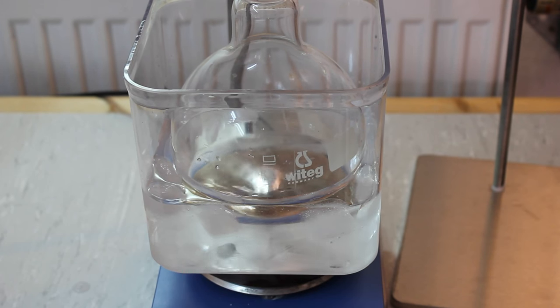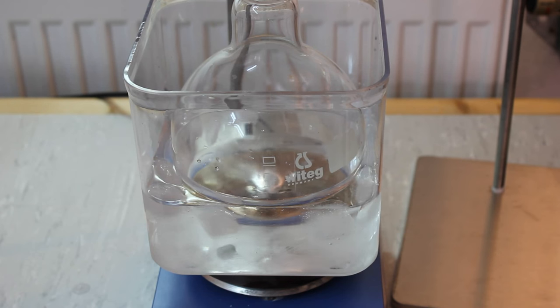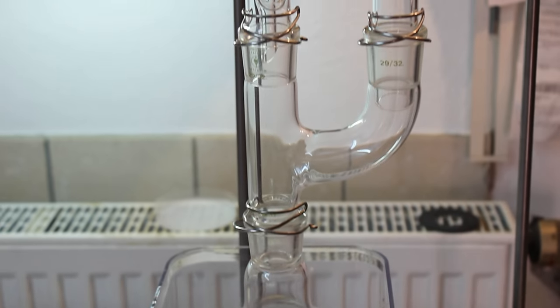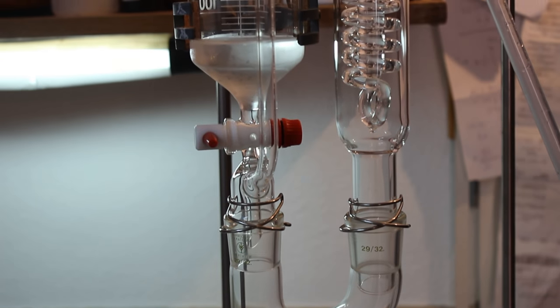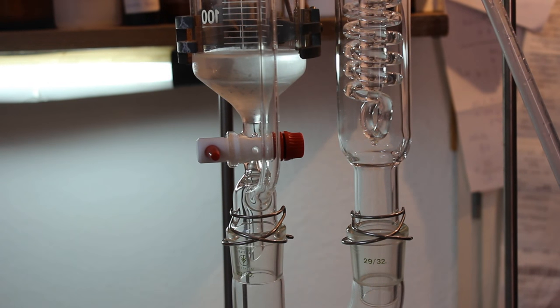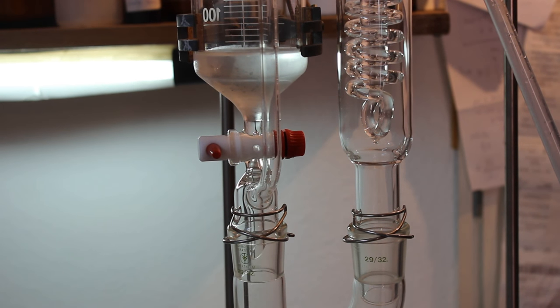The first thing we have to do is add the sulfuric acid to our ethanol. I have a 1 liter flask containing the ethanol sitting in an ice bath, on top of which I've added a Claisen adapter with an addition funnel and a cooler. The addition funnel contains our sulfuric acid, and the cooler is there to condense any ethanol that might boil off since the addition is quite exothermic.